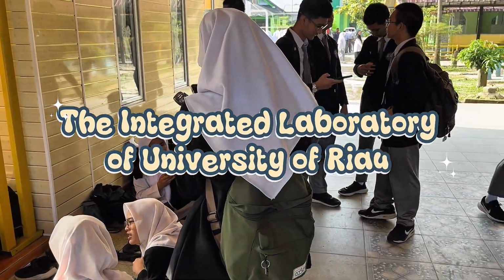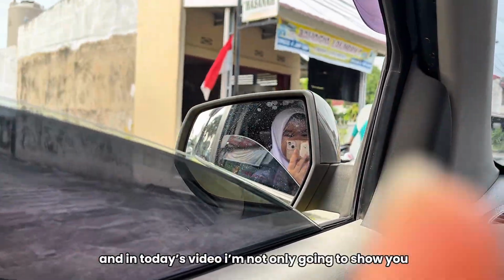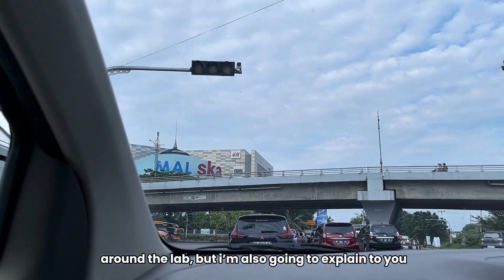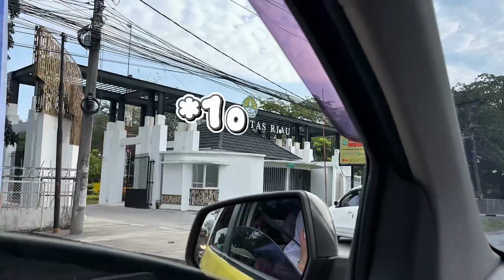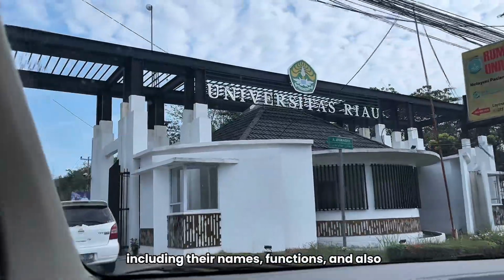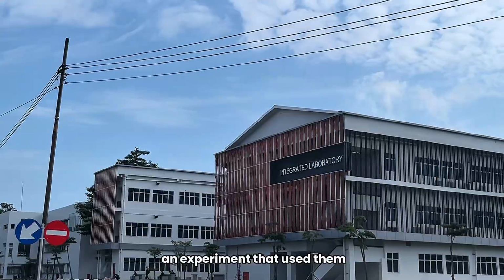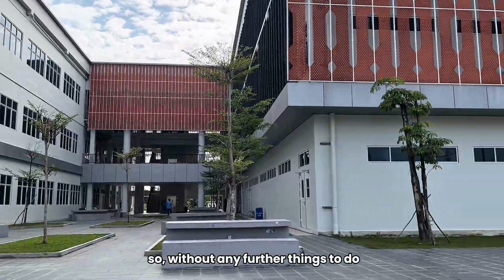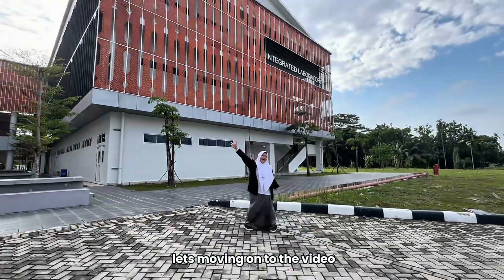Today is super exciting for me because my school is going to visit the integrated laboratory of the University of Riau. In today's video, I'm not only going to show you around the lab, but I'm also going to explain 15 laboratory equipment, including their names, functions, and also experiments that use them. So without any further ado, let's move on to the video.